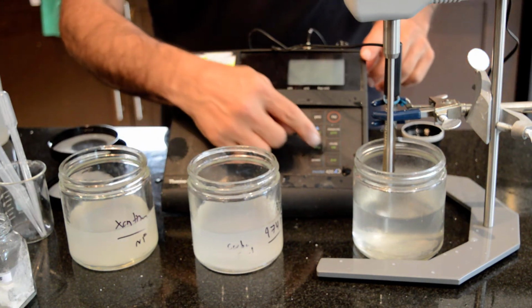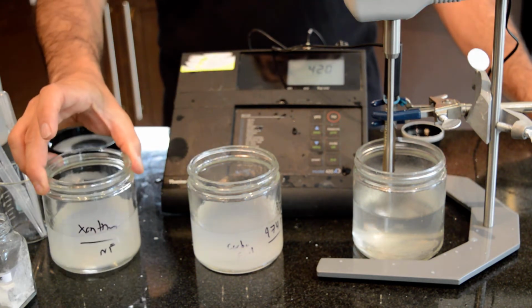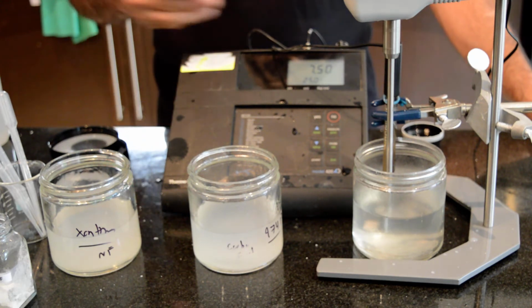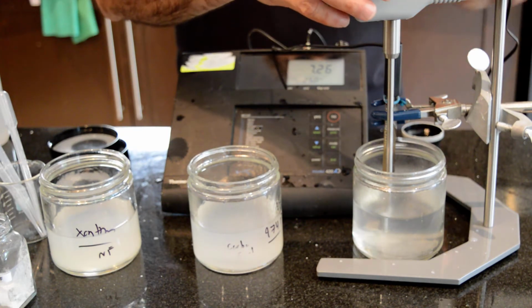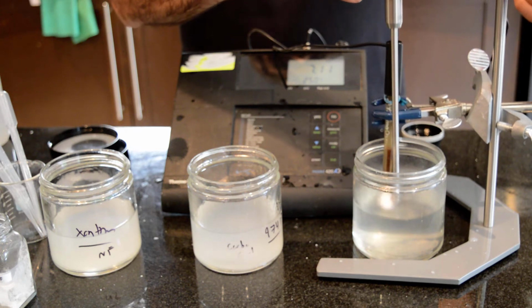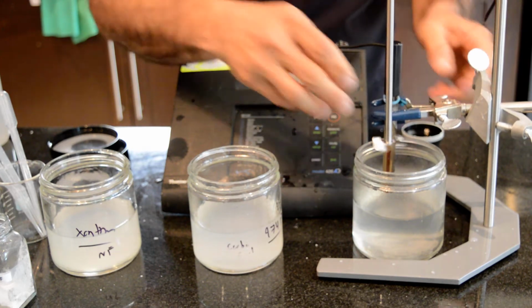You don't need to do pH adjustment with the xanthan gum. Xanthan gum was 7, already neutral, but in the case of alginic acid, that was needed. Similarly with the carbomer. Carbomer also needs the pH adjustment. Anyway, the alginic acid reached a pH of 7.3. This is a very nice pH that I actually was looking for. I'm going to stop pH adjustment for alginic acid, and I'm going to do the same thing with the carbomer.